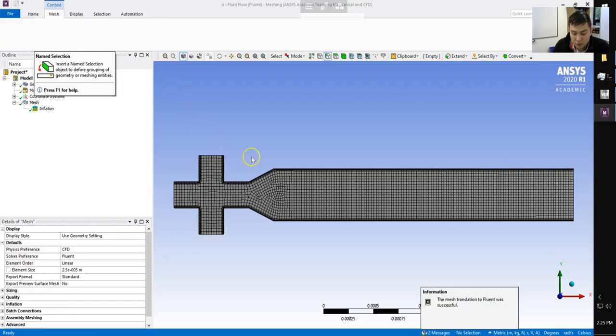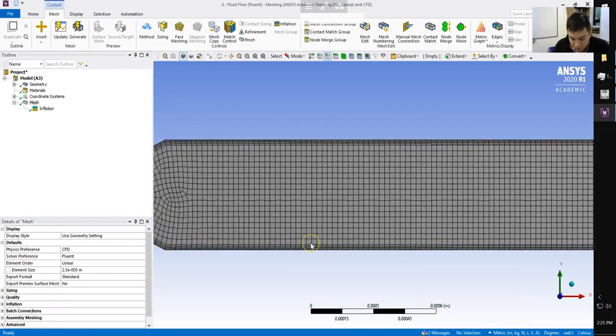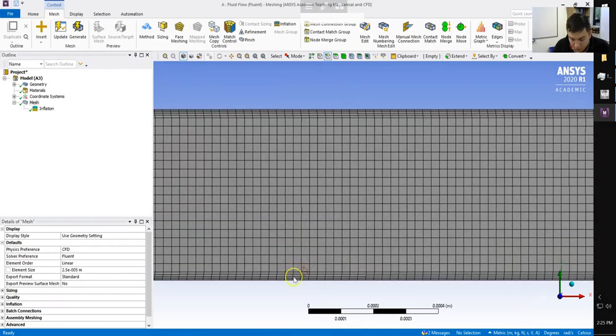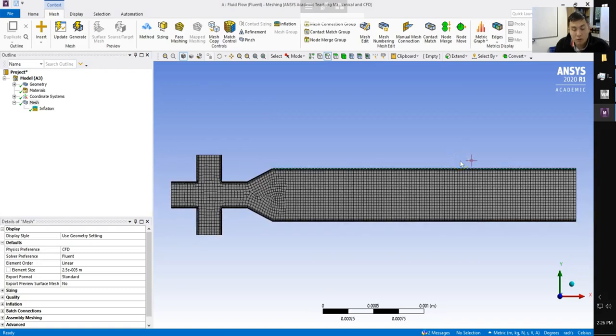Okay, and so you can notice we've got a higher resolution set of cells on the edge, and so we can zoom in a little bit and see how we have high resolution, very thin, long cells at the edge, sort of form nice square cells in the middle, and then go back to long, thin cells at the top and bottom of the boundary. And this goes throughout our geometry. So that's all we're going to do with our mesh.